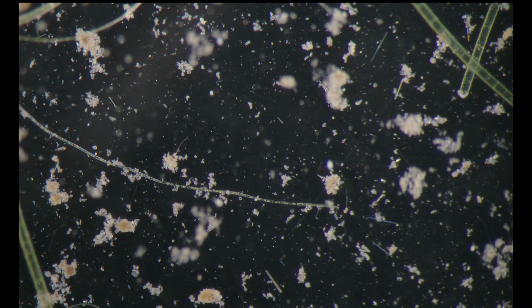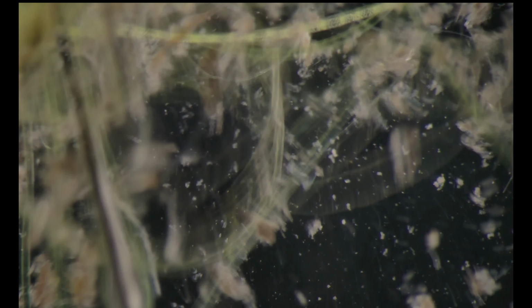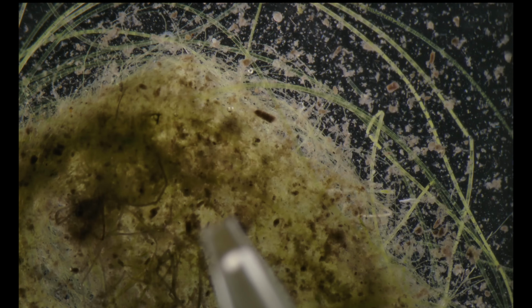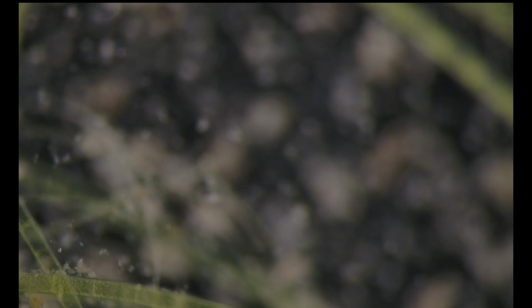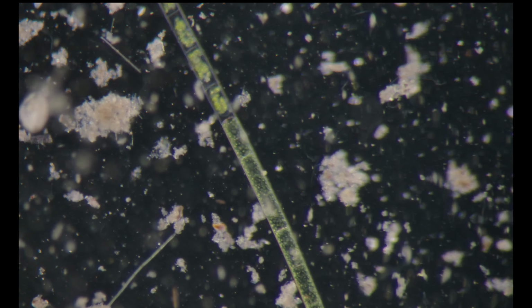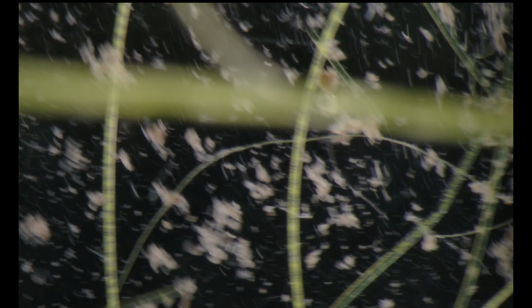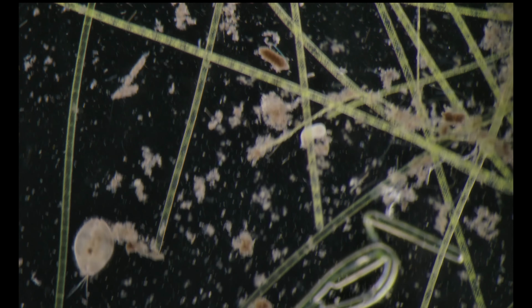Okay, I don't know where all the Nuclearia went. Okay, so it's not a lucky day with amoebas.